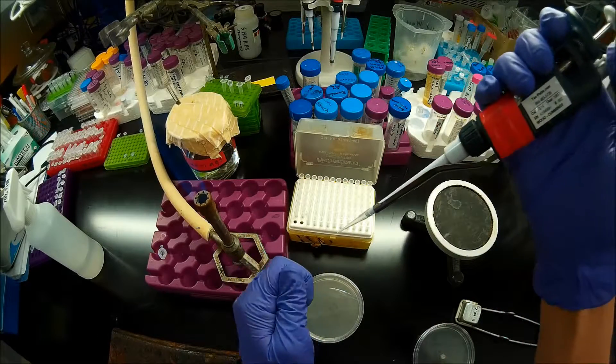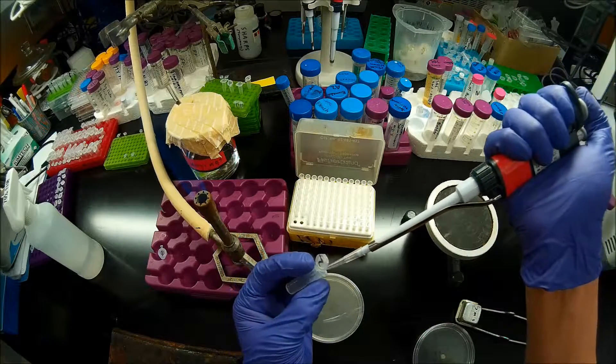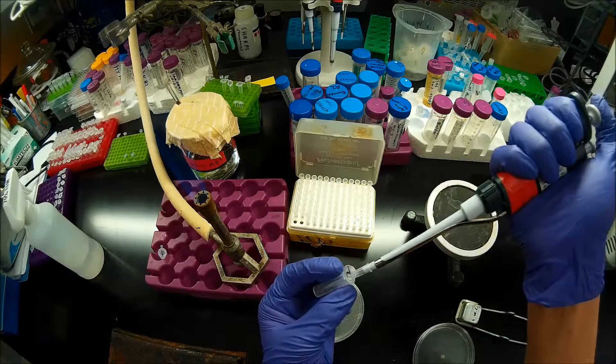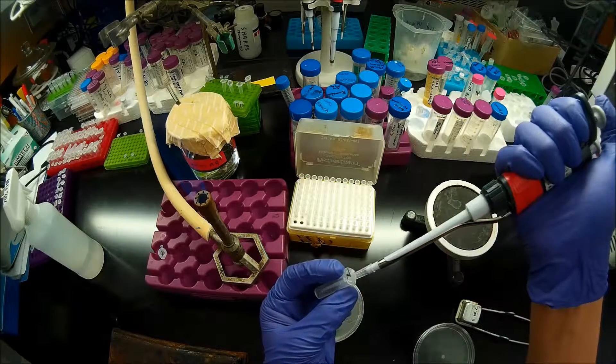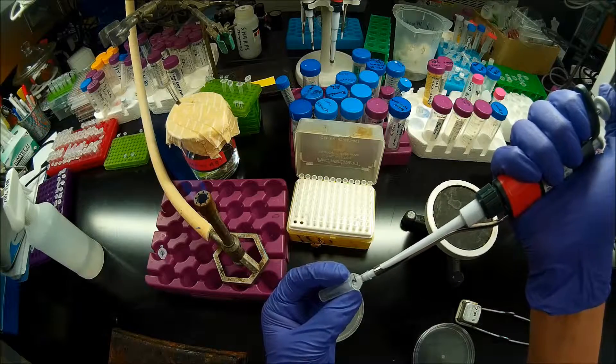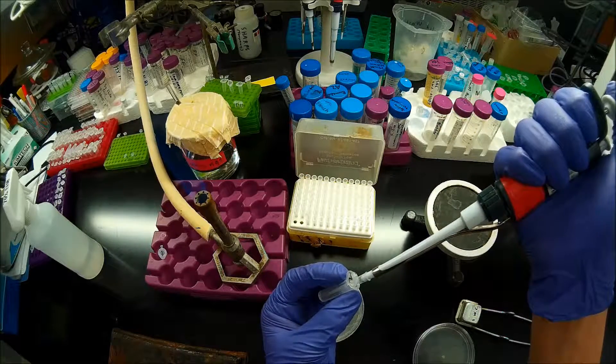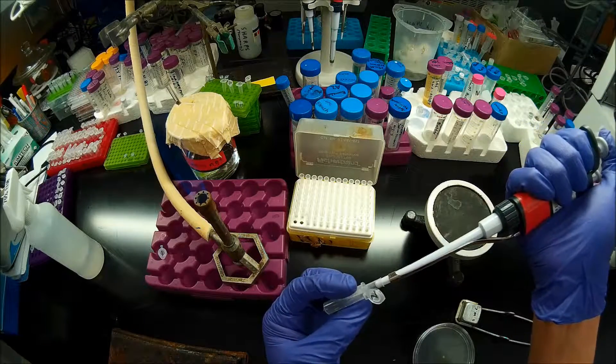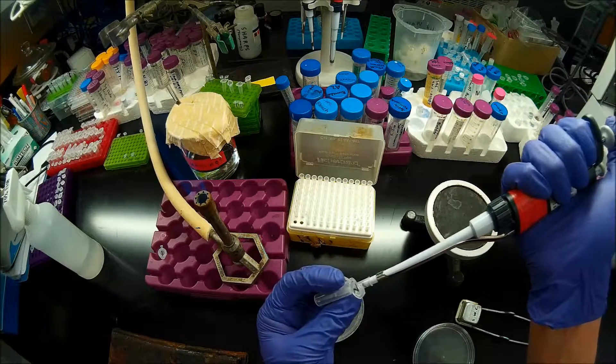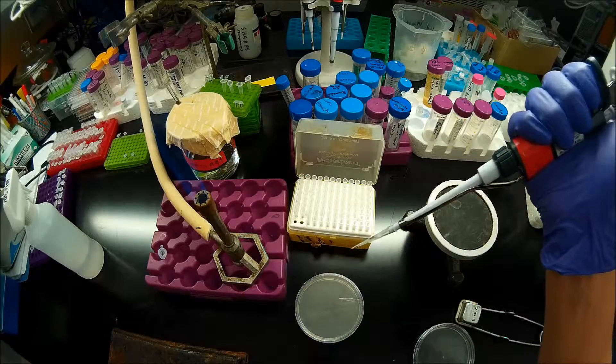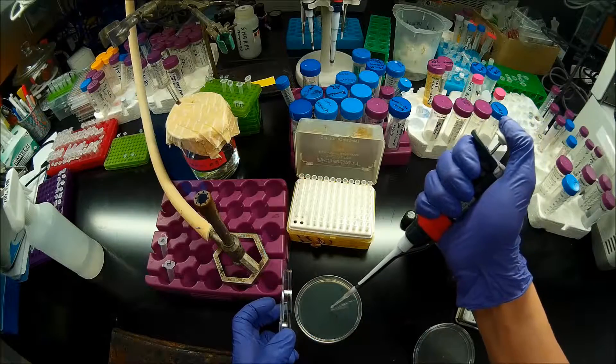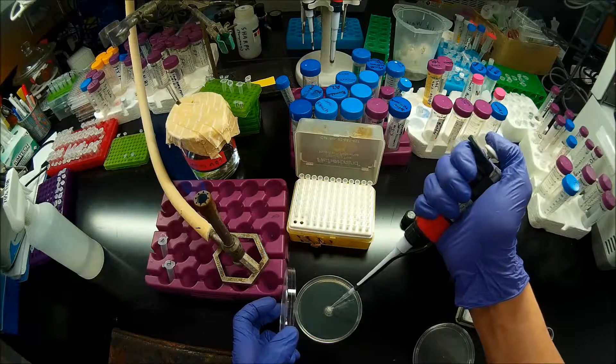And now for ligation transformation two. Aspirate all of the cells. And I'll dispense those onto this second plate here.